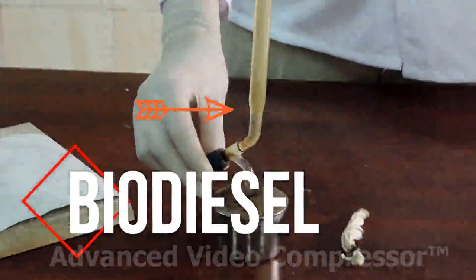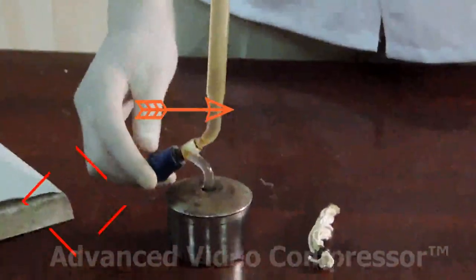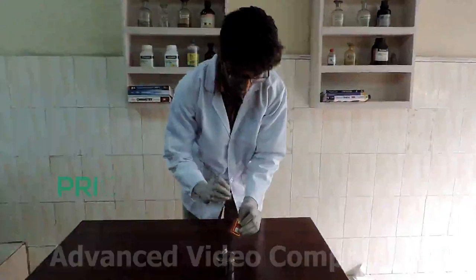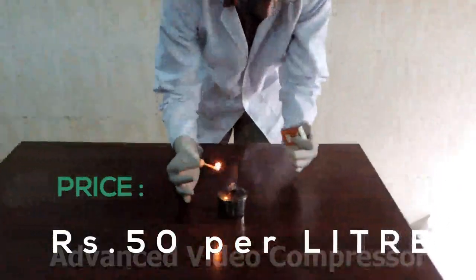Next comes the upper layer which is biodiesel, which is our main product. Now we have added this biodiesel into an empty spirit lamp. Ignite it and look how brightly it burns.